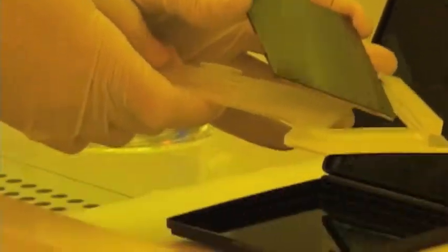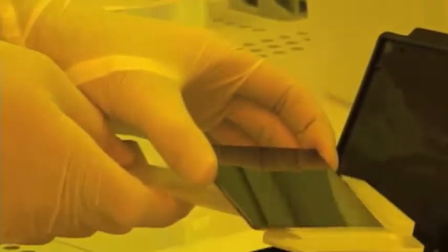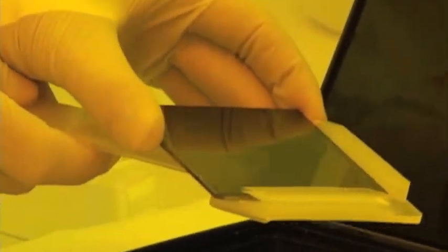Before we wash away the photoresist, you can't see the design. All right, now we transferred the mask from the corrosive material into the water. Now we're rinsing it to clean it off.